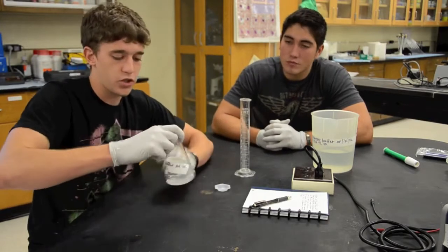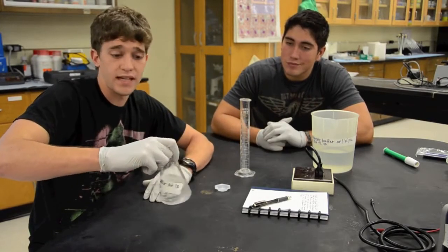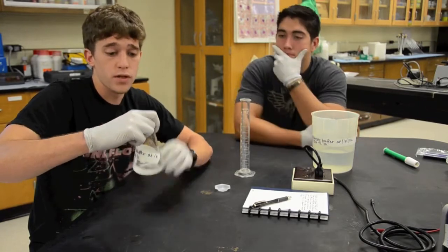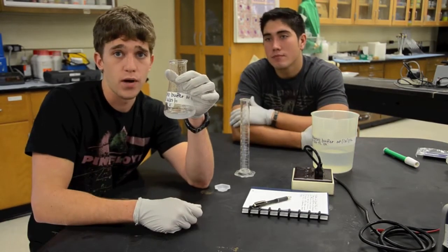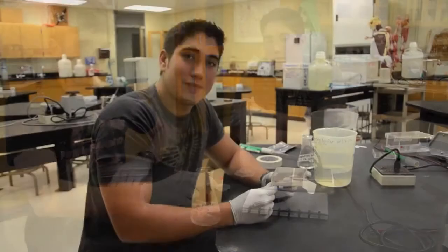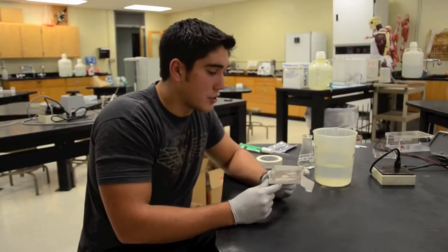Then we're going to swirl the mixture to get any clumps out before taking to the microwave. It's also important to use this shape of flask in order to minimize the evaporation.